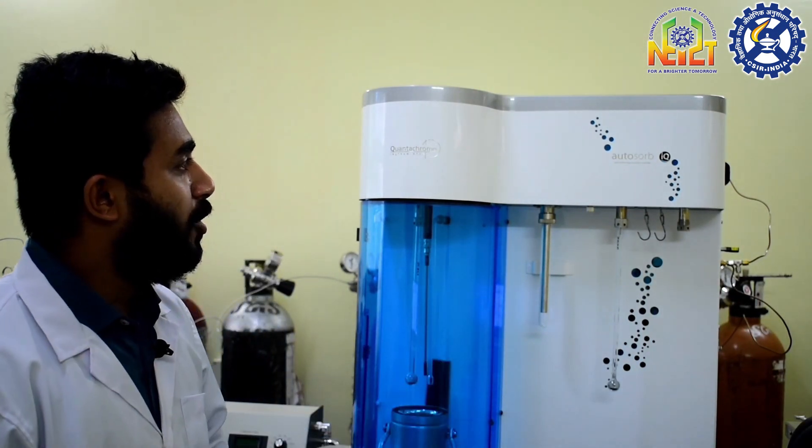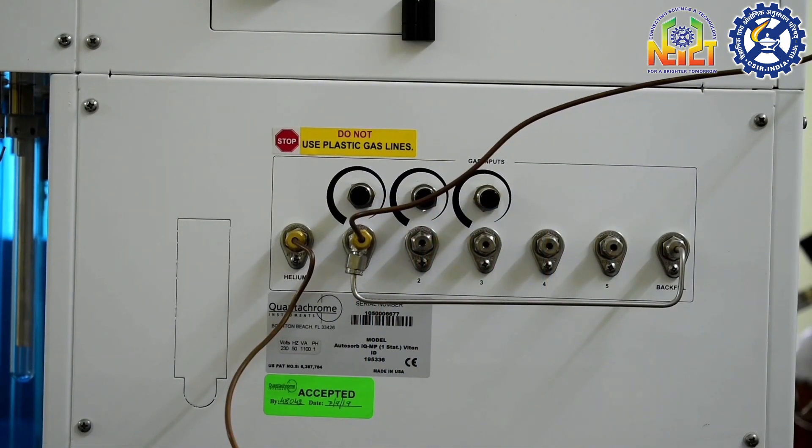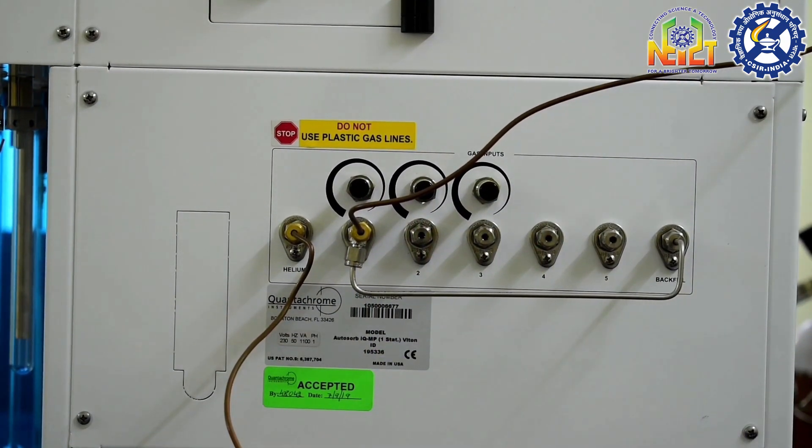This is our Autosorb IQ BET surface area analyzer that we have in our laboratory. Our Autosorb IQ has basically seven gas-fitting ports.